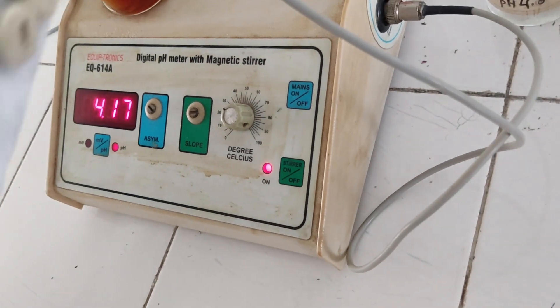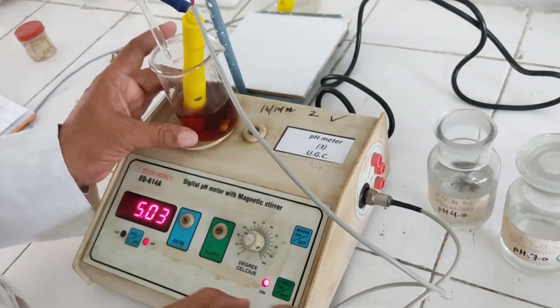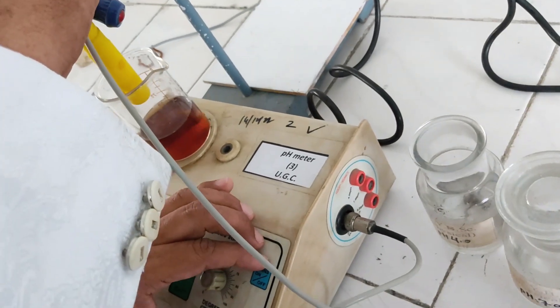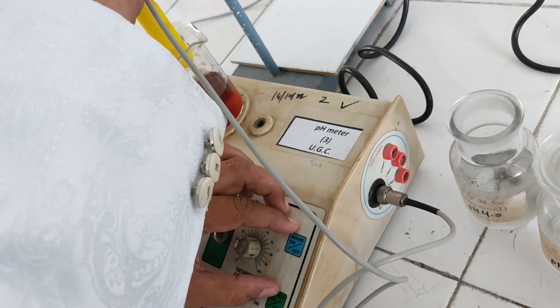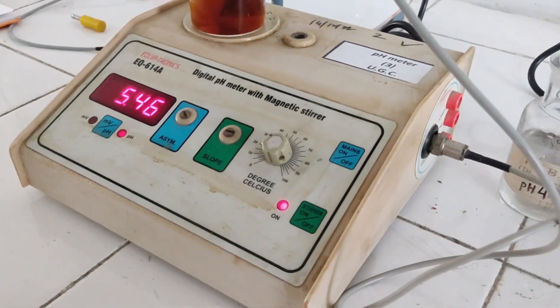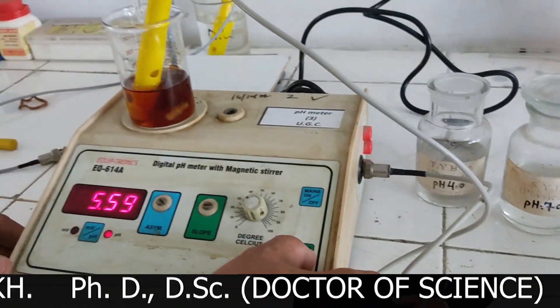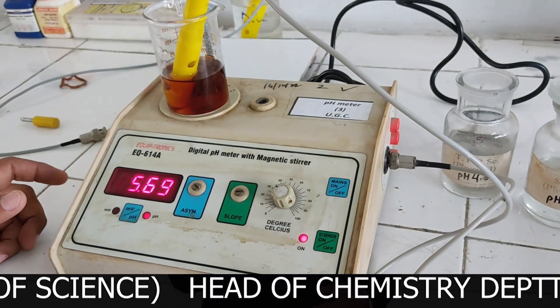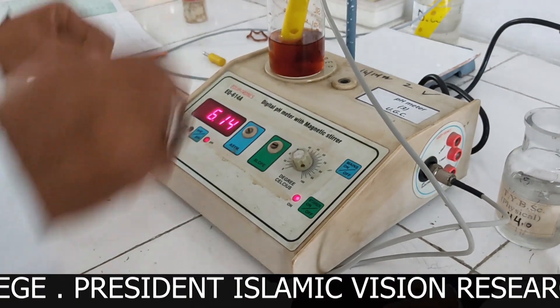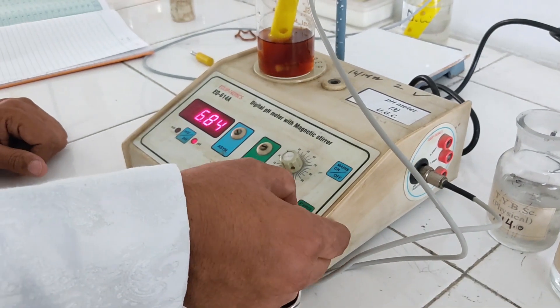25 centimeter cube. Students always face this problem, so you have to be very careful with the magnetic stirrer — off and then on, it will keep moving. You can see the pH has increased. pH is increasing with each addition of NaOH.